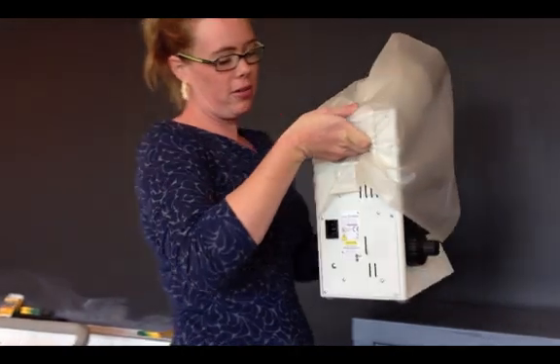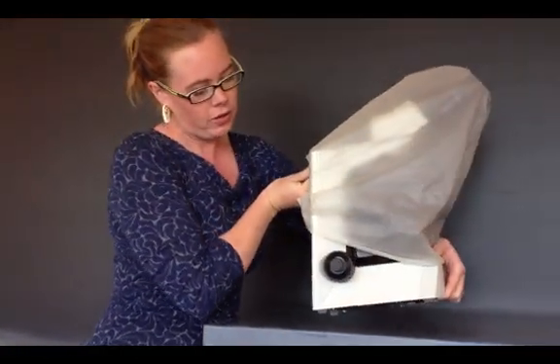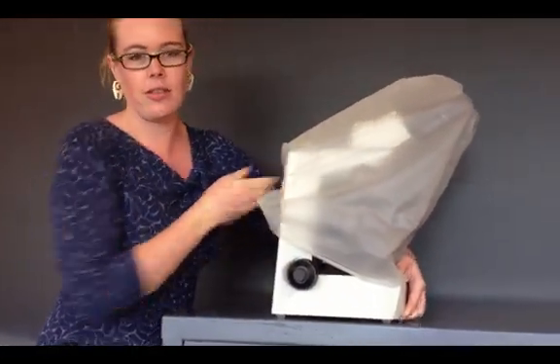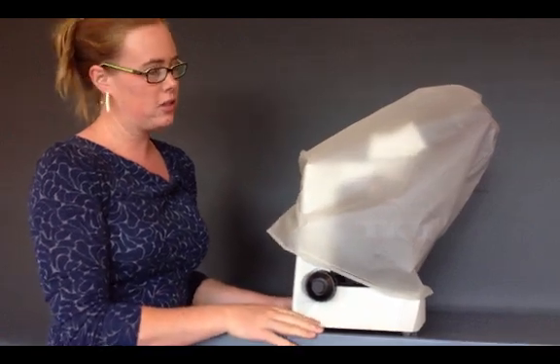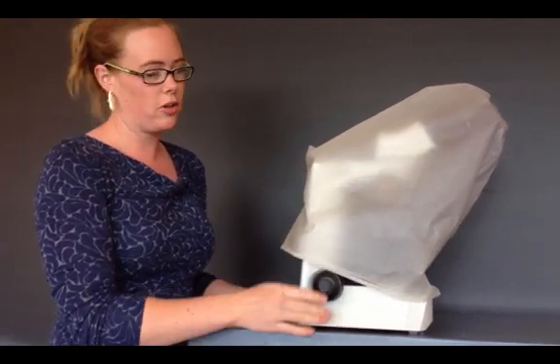Then when you set your microscope down, you don't want to slide it across the table because doing so is going to create vibrations which could break it.